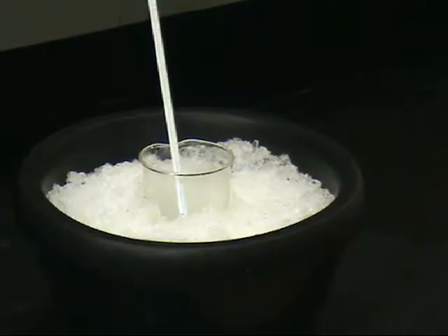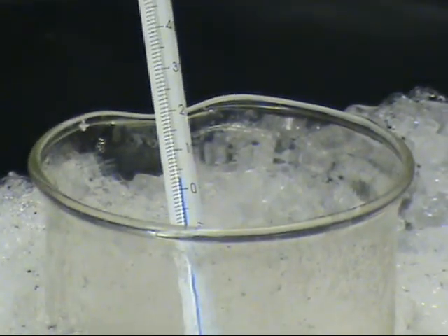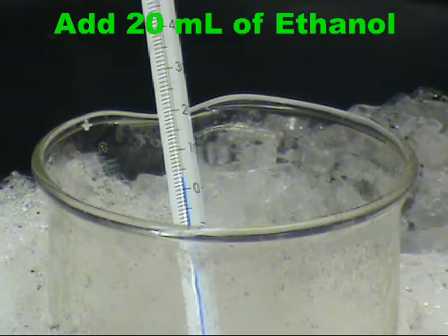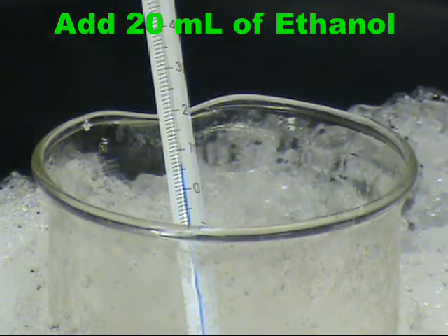The solution is then placed in an ice bath and cooled to a minimum of 5 degrees Celsius. 20 milliliters of ethanol are then added and the solution is allowed to crystallize for 15 to 20 minutes.